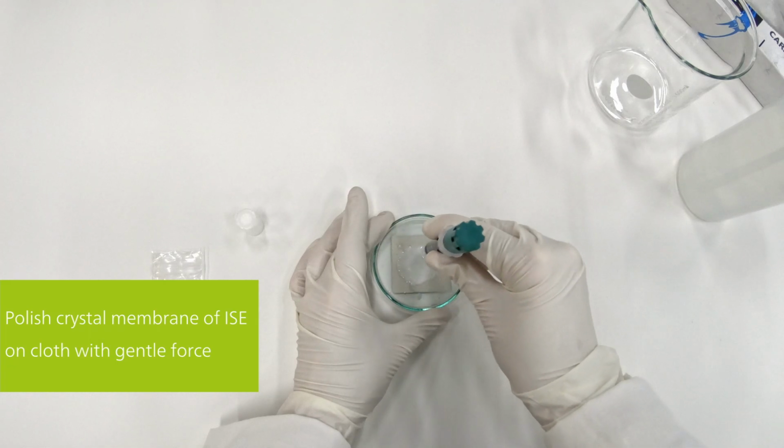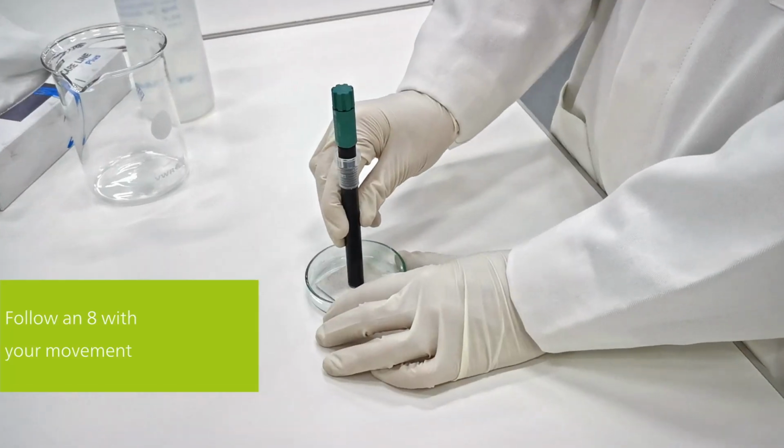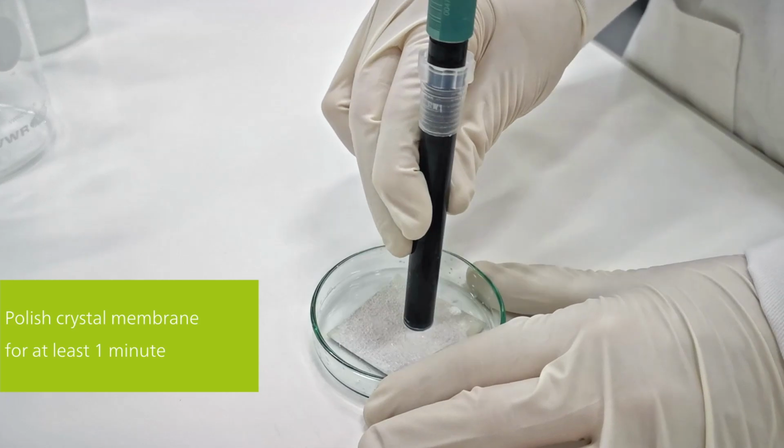Then rub the crystal membrane surface on the wet cloth by applying gentle force. Your movement should follow an 8. This has to be done for at least 1 minute.